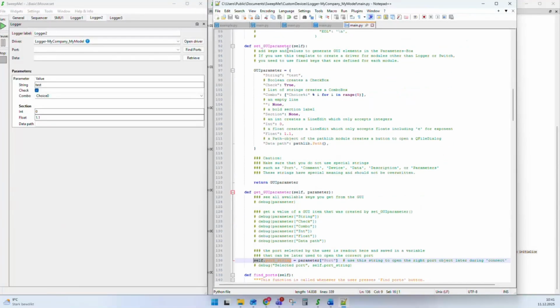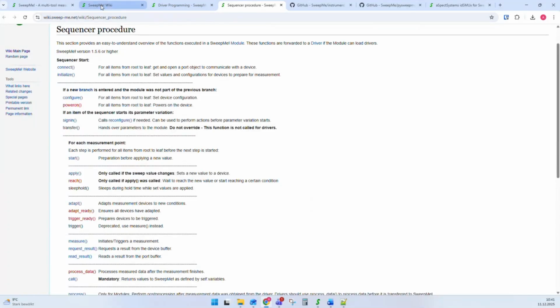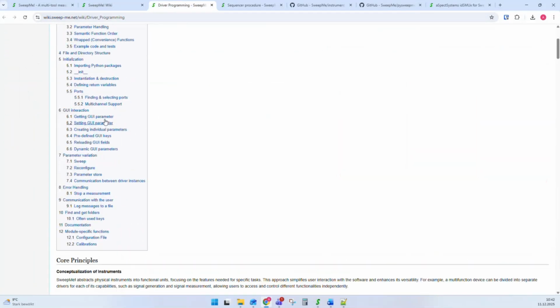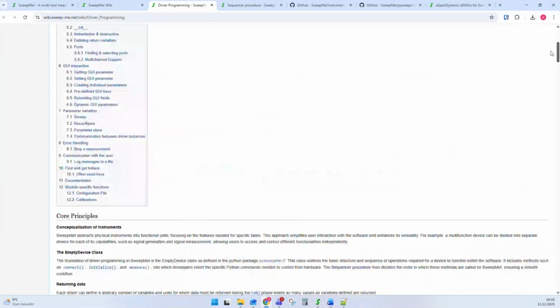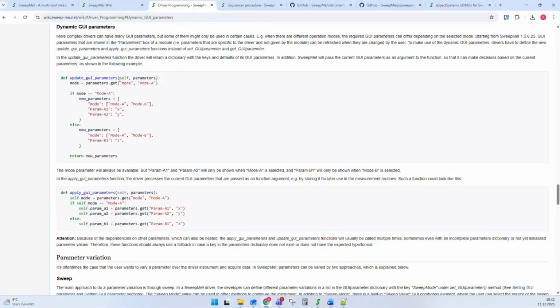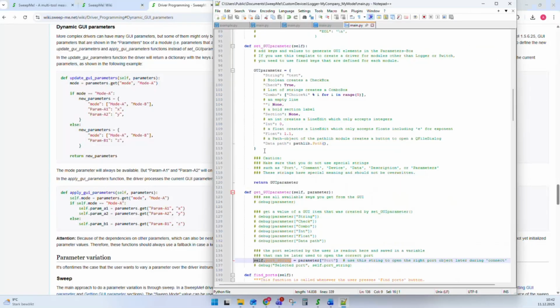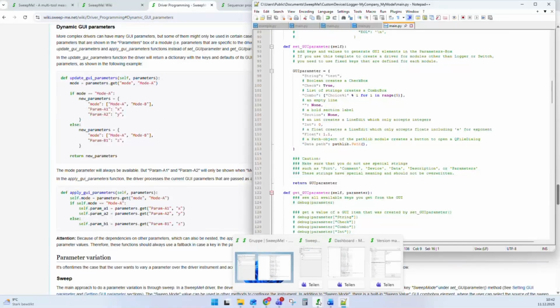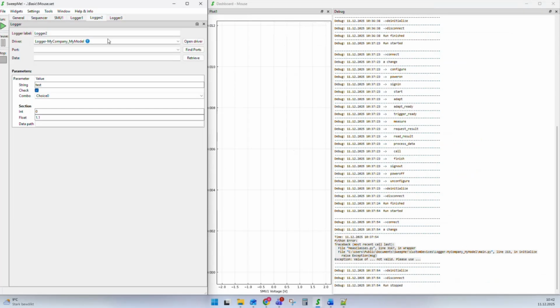We have changed the system a bit with set and getGUIParameter. Let me go to the documentation of the driver programming. You can find it here in the wiki. Driver programming, I already opened it. And there we basically wrote everything in that I'm telling you right now. And there's also something with dynamic GUI parameters. We have also added a new set of functions that are called updateGUIParameters and applyGUIParameters. They are now step by step replacing these setGUIParameter and getGUIParameter functions. And the advantage of these dynamic GUI parameter functions is that you can now change the dictionary that you return based on input parameters. This means, let me show you this in a driver.